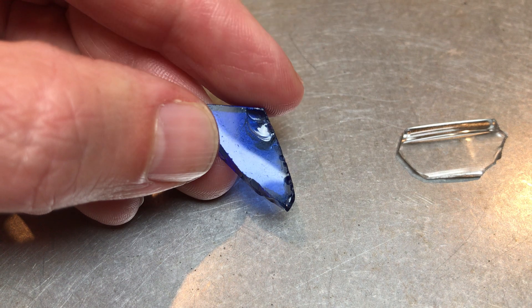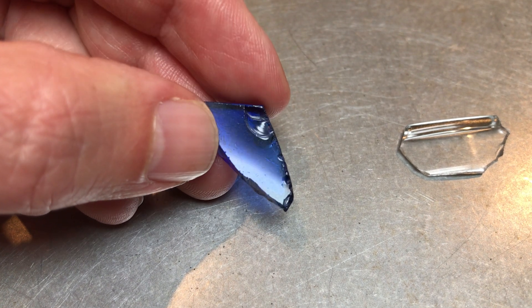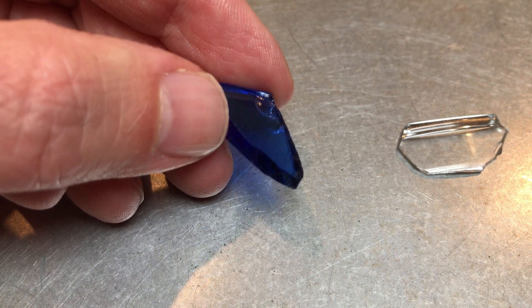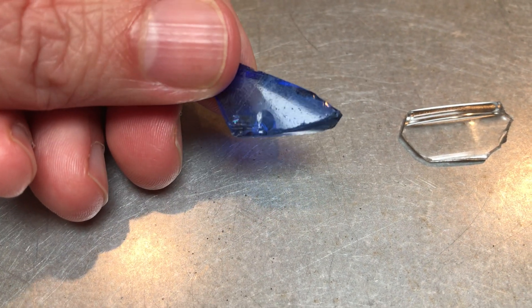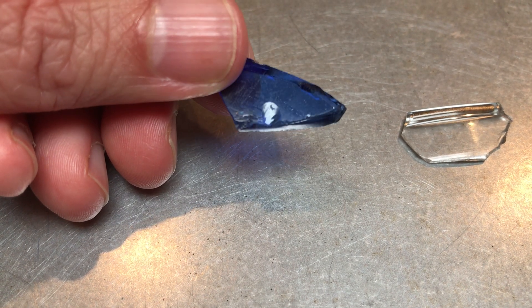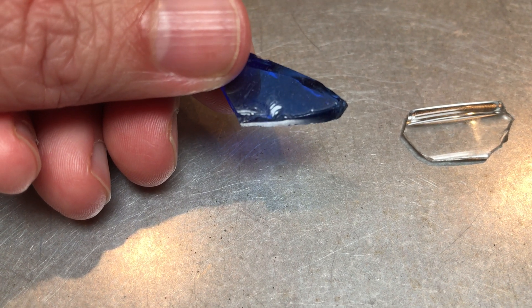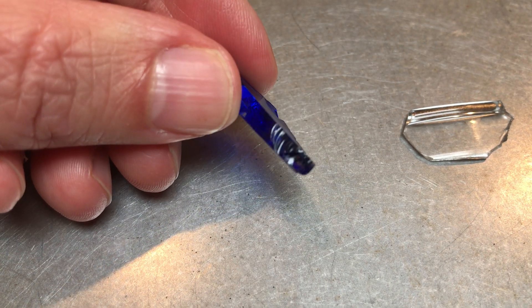Up here by the tip of my finger there's a very large chip that was taken out of the glass. You can see a couple of chips on the other side as well. So while this one doesn't have any markings, it certainly does have chips.